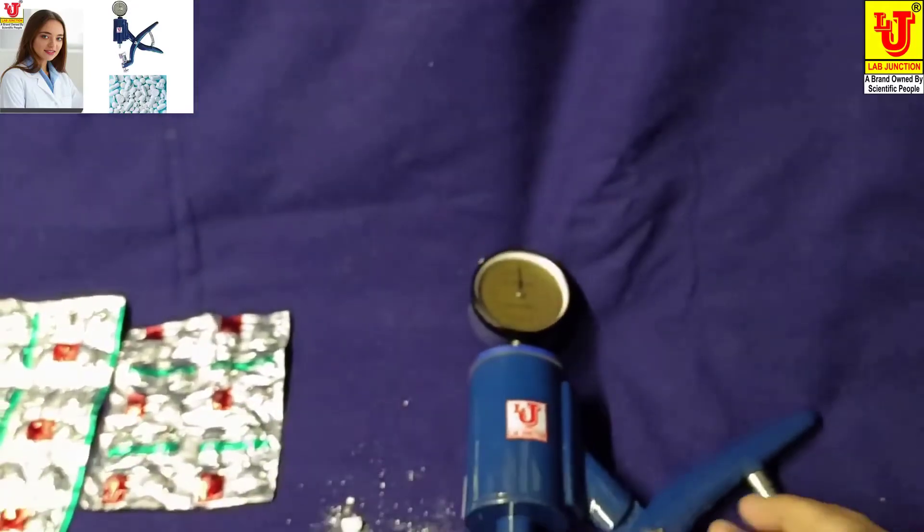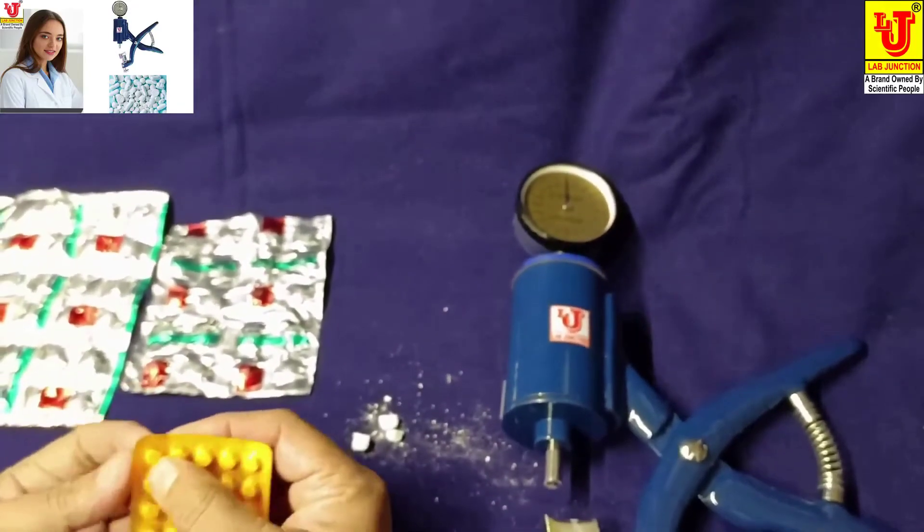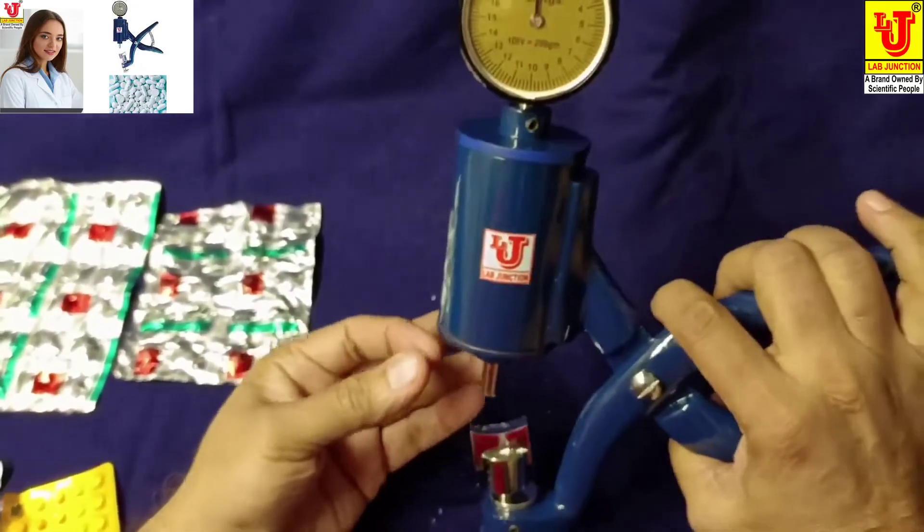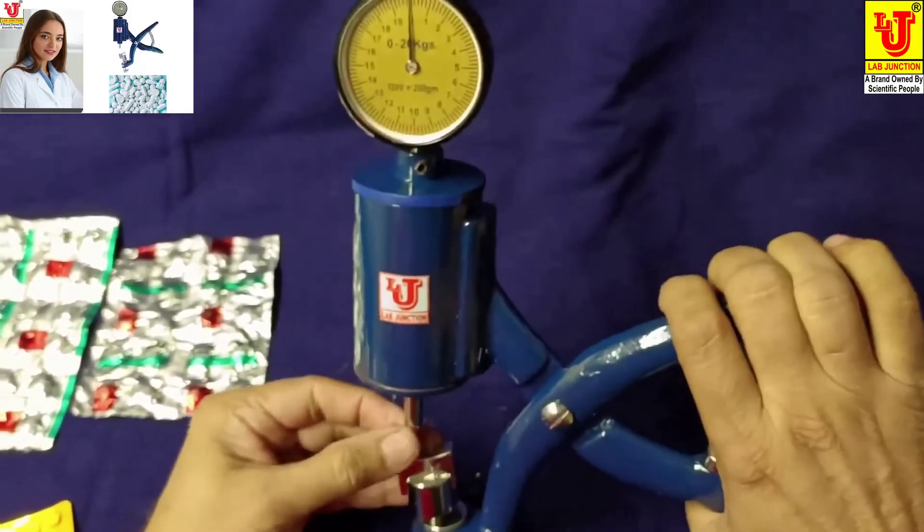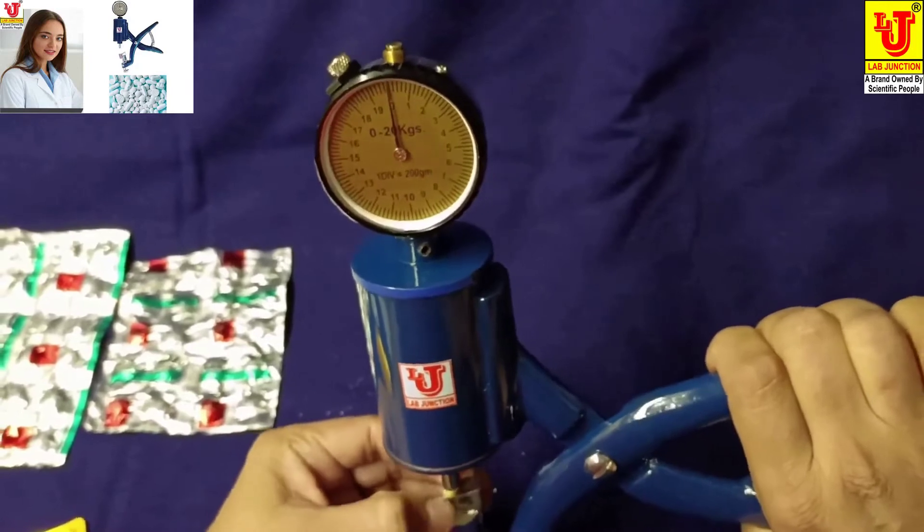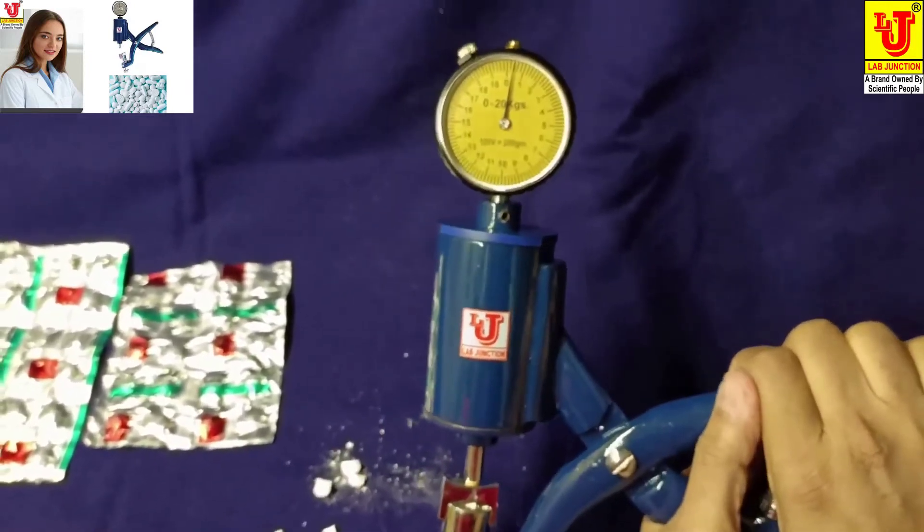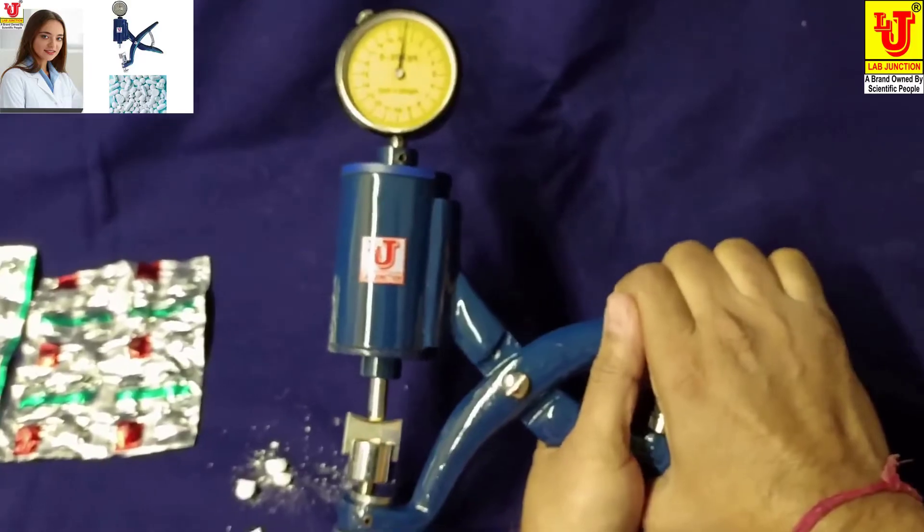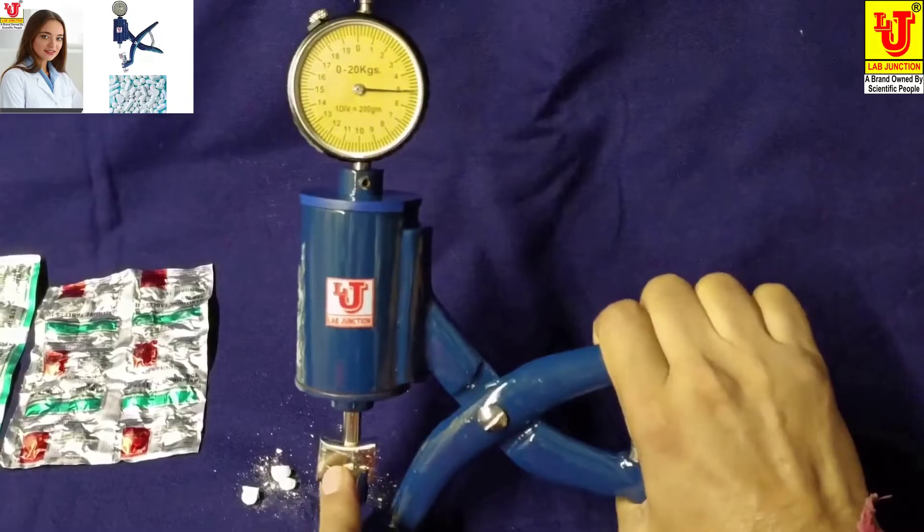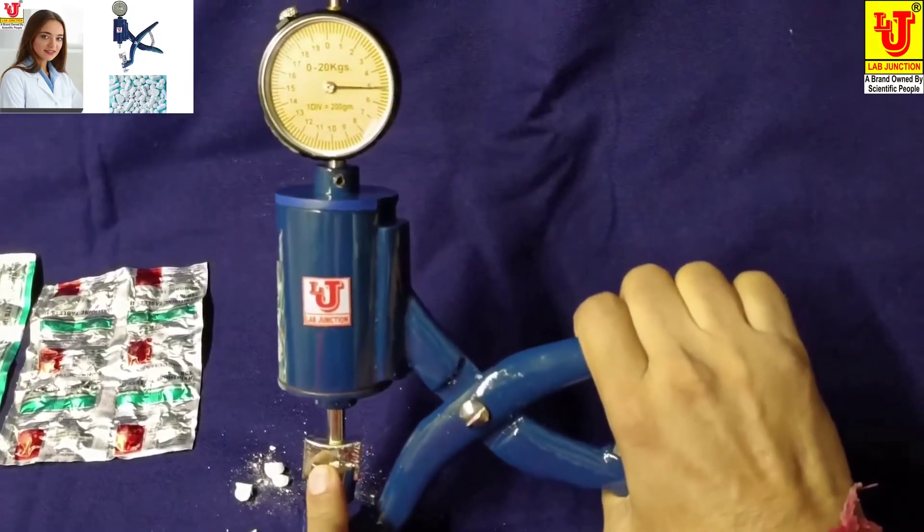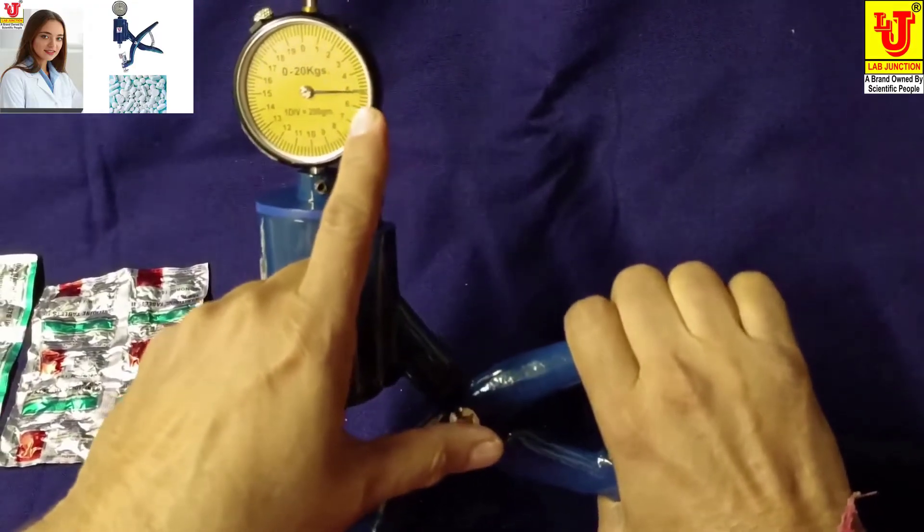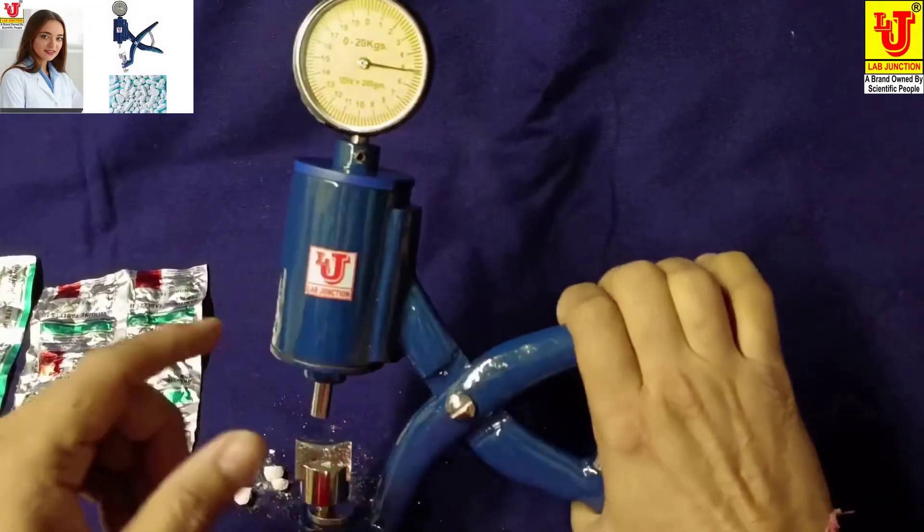I am taking another small tablet and placing it in this position. Apply force like this. The tablet crushes and breaks at 5 kg force.